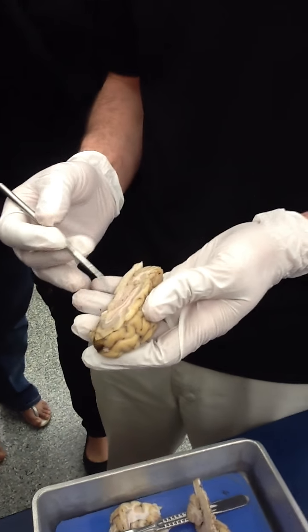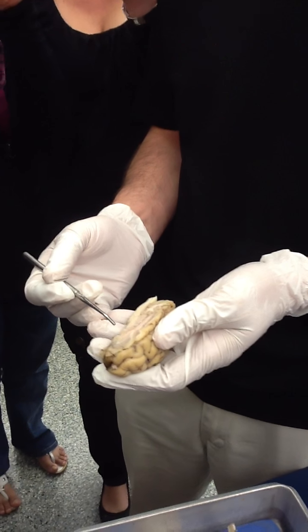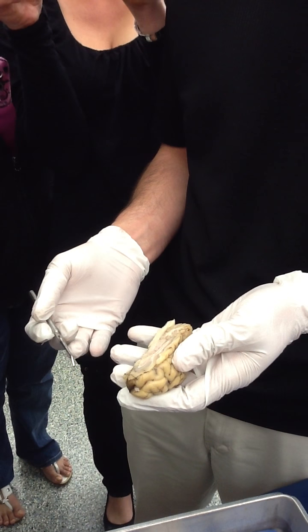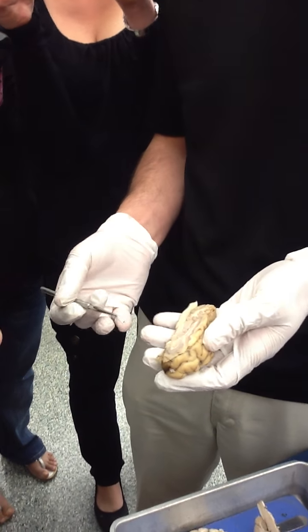Good morning. Good evening. This is Mike Mangino, anatomy instructor here at Harper College, giving you a demonstration of the sheep's brain.